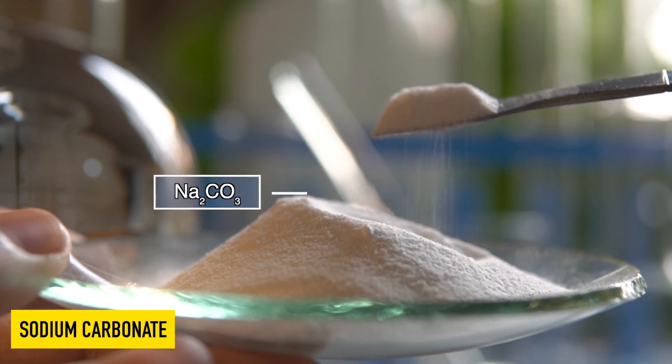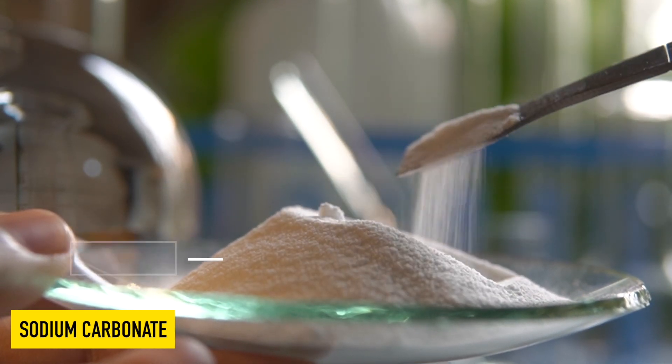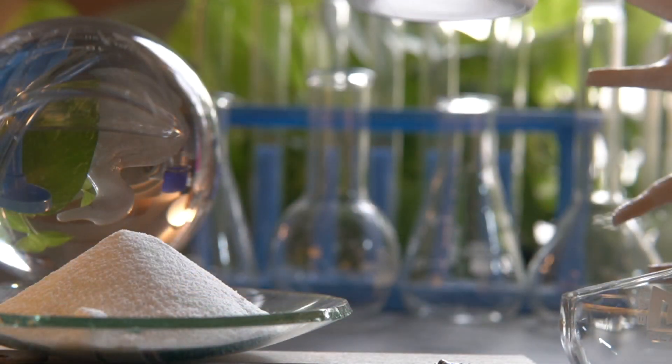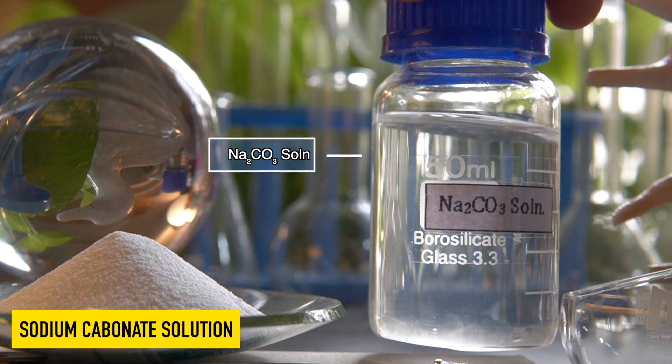This is sodium carbonate, or commonly called washing soda. It can be easily dissolved in water to make a homogeneous clear solution.